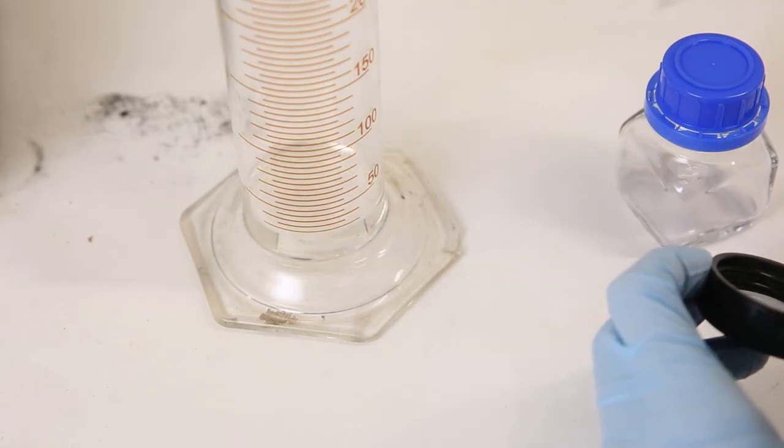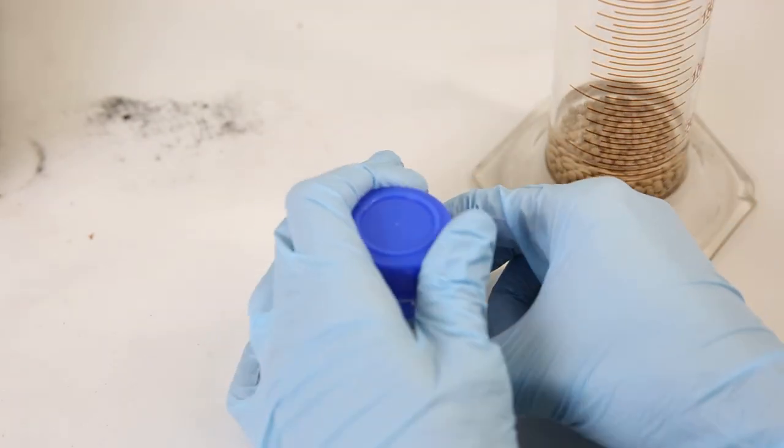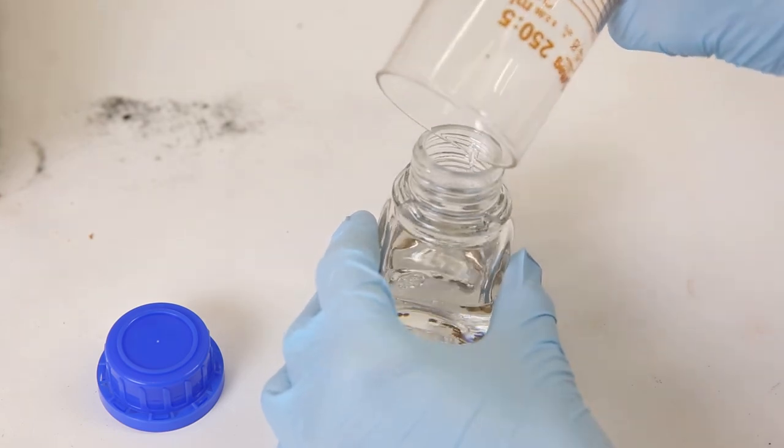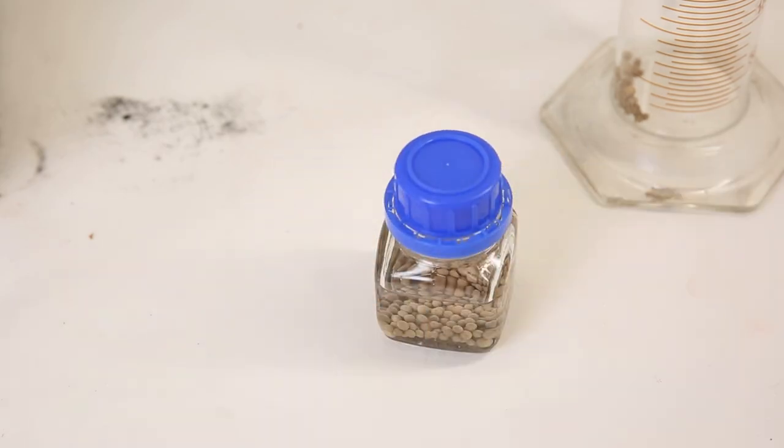My final yield of benzene was around 30 milliliters, which is pretty low. So definitely use the improvements I mentioned before to improve the yield.